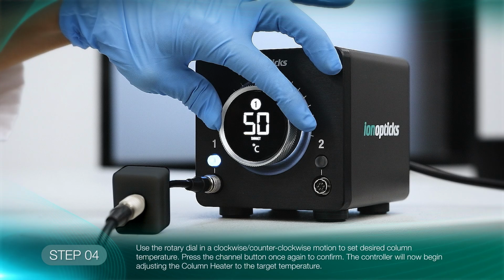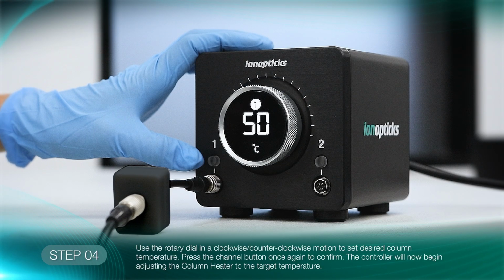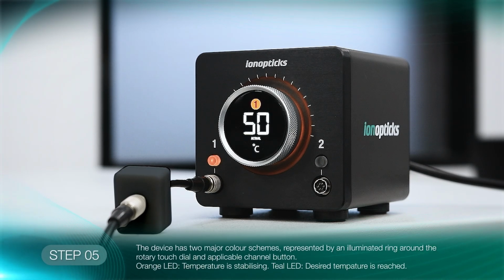The temperature displayed on screen will represent actual column temperature inside the housing. Once the desired temperature has been selected, press the flashing channel button once again to confirm. The controller will now begin adjusting the column heater to the target temperature. It uses 2 main color indicators to show its status. Orange indicates the controller is actively adjusting the heater to the target temperature. Teal indicates the heater has reached the target temperature and is stable.